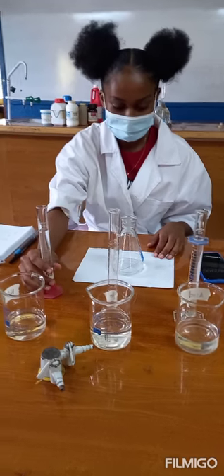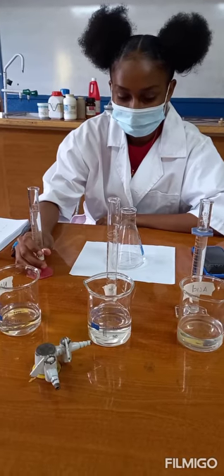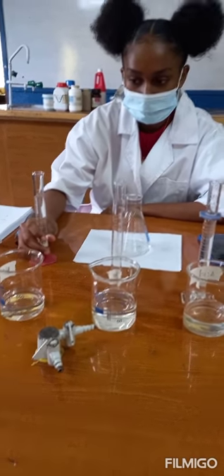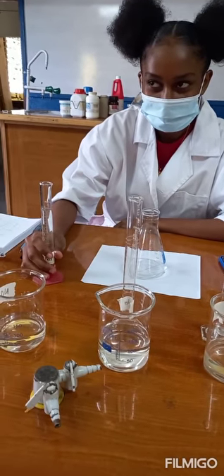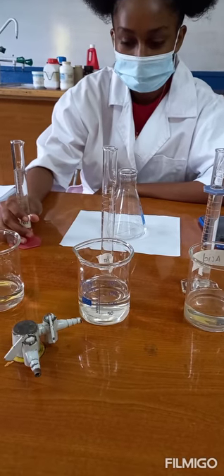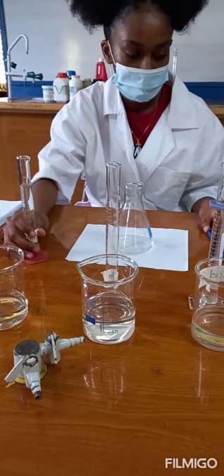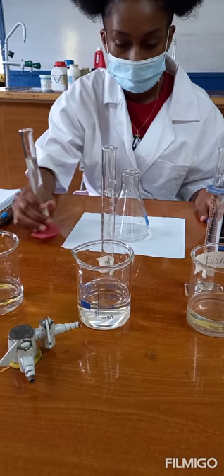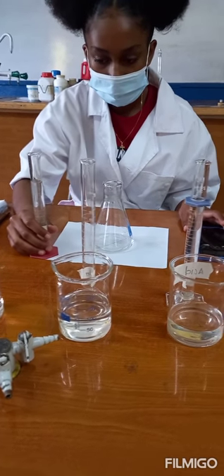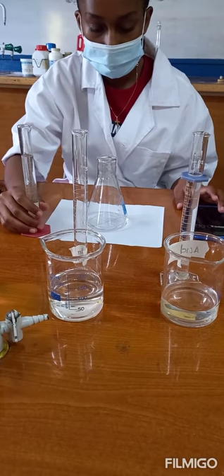In this video we will be doing a rates of reaction experiment using sulfuric acid and sodium thiosulfate. We are assessing the effect of concentration on the rate of reaction. In the first trial we are going to add 25 cm³ of sodium thiosulfate to the sulfuric acid which is already in the conical flask.